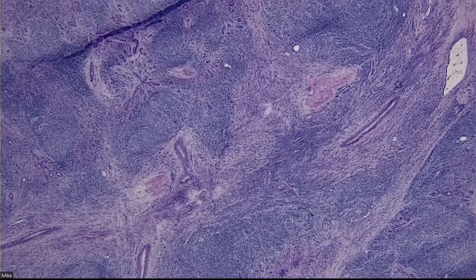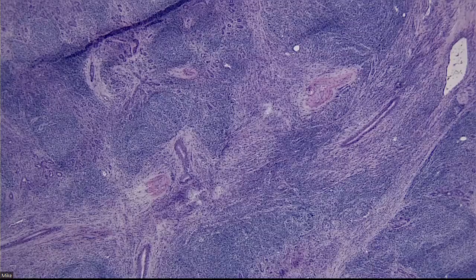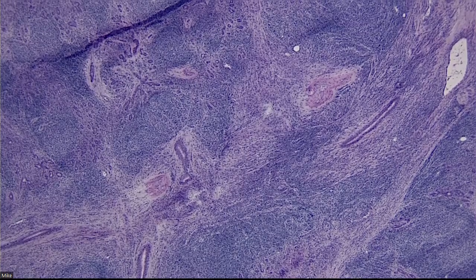Right, so we don't really see salivary stones very much, even though they're a common reason for salivary swelling or mass forming lesions. Because they try and massage them out, they do lithotripsy. On rare occasion, they get resected, so we might see a resected stone. We sometimes see them for gross only, right? But we don't really see stones, so we don't really talk about them, but they're a really common reason for swelling in the parotid or submandibular gland. All right, so this was submandibular.